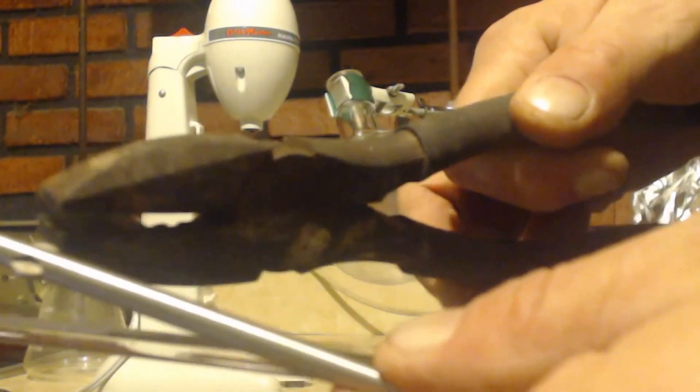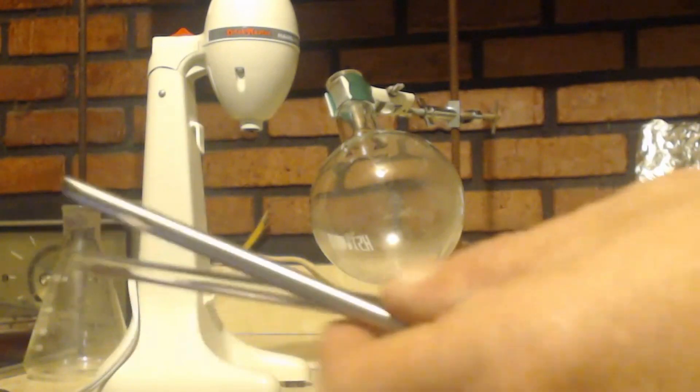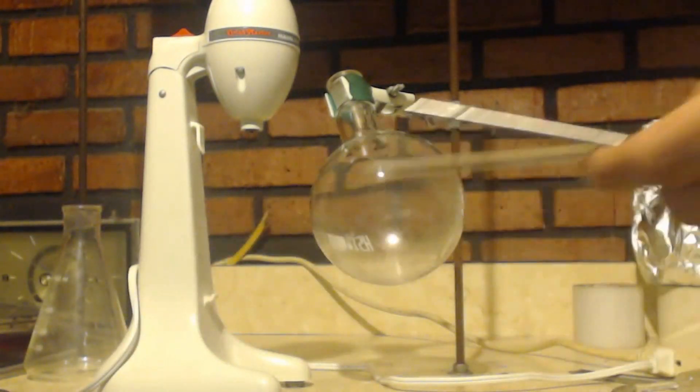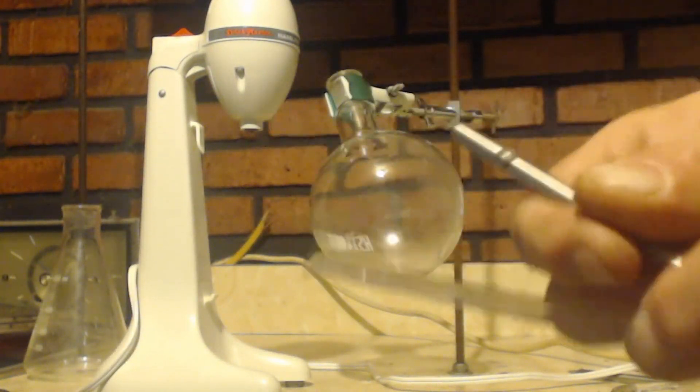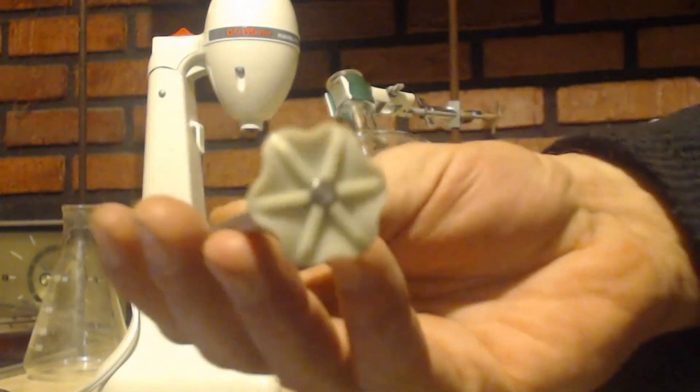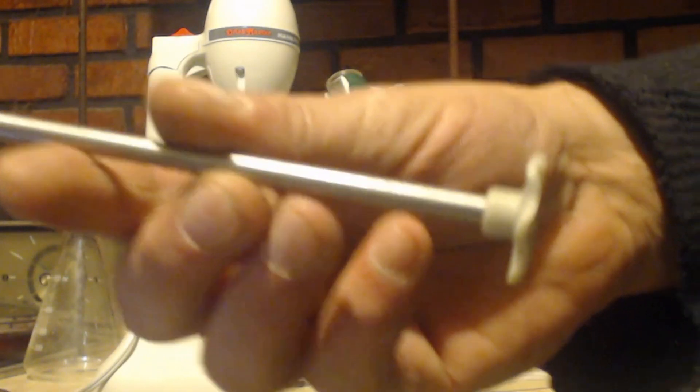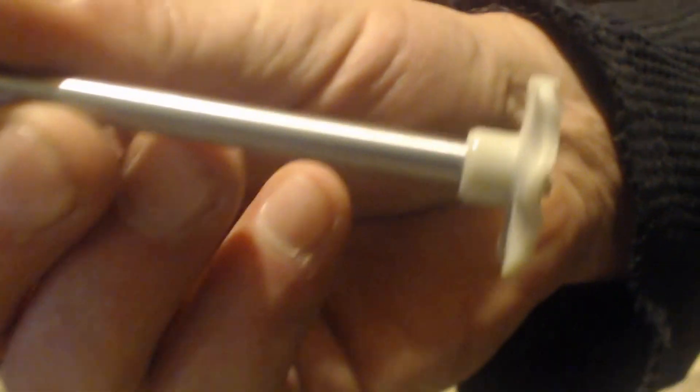Then squish it on this side, and if you can do it exactly the right dimensions, you can use glass. Otherwise you're kind of stuck with this particular piece right here. You can see it's metal and it has some plastic on the bottom of it.